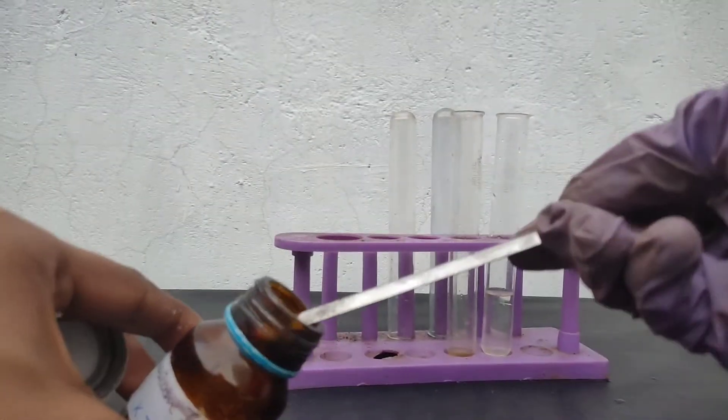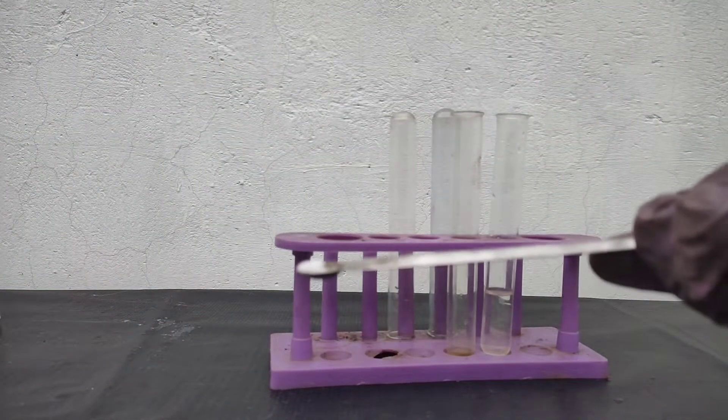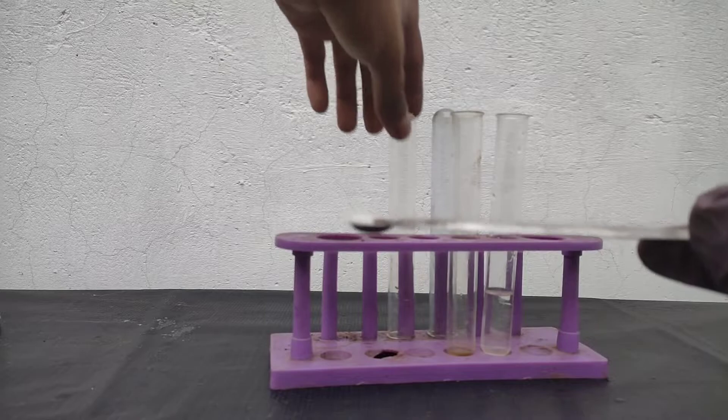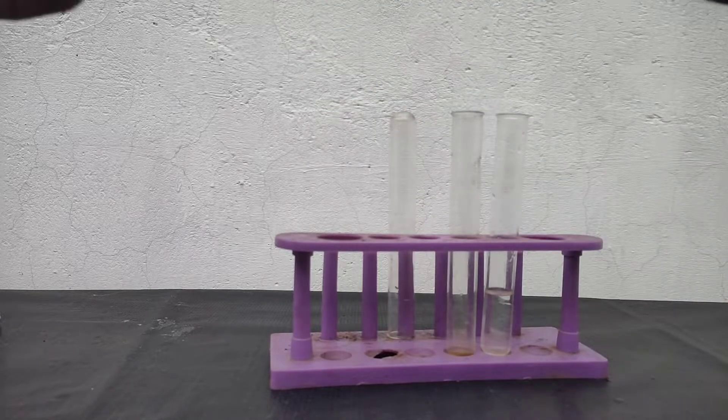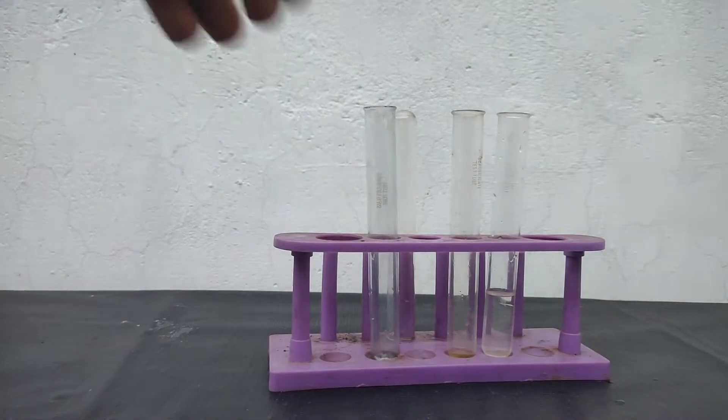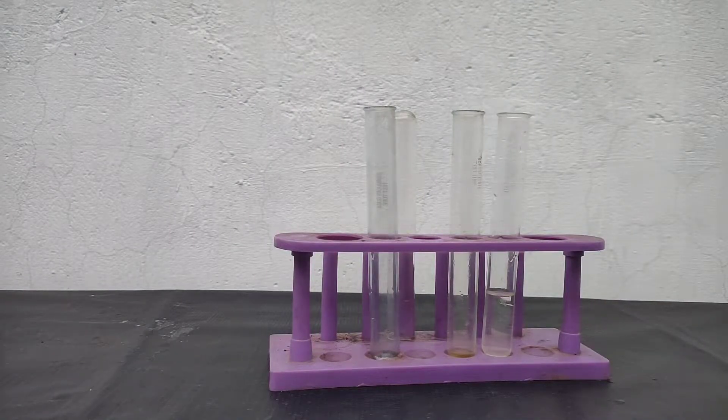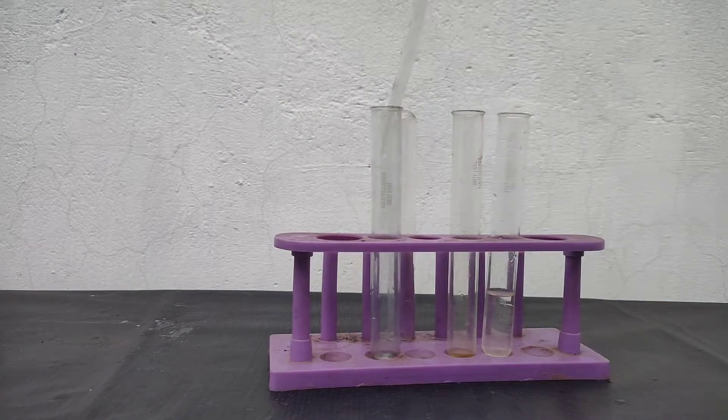It is a white crystalline salt. So for that I will take a pinch of salt into a test tube. To this I will be adding concentrated sulfuric acid.